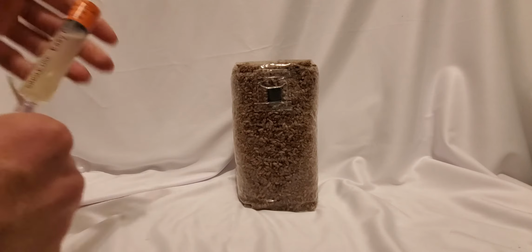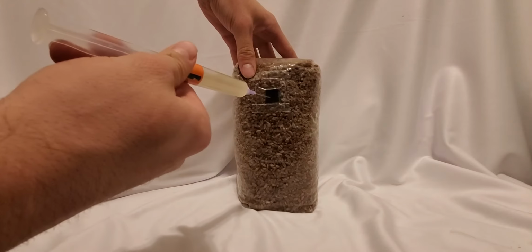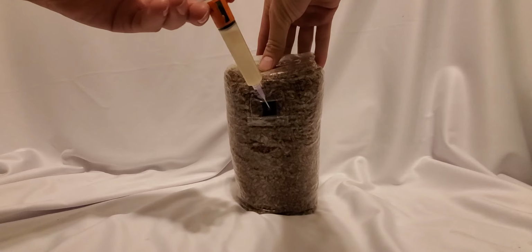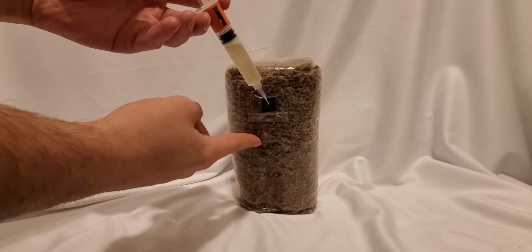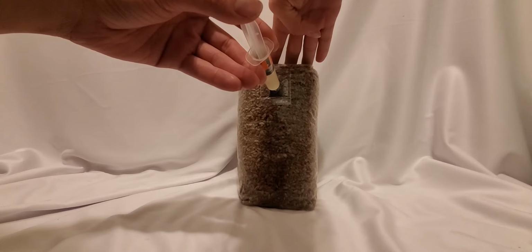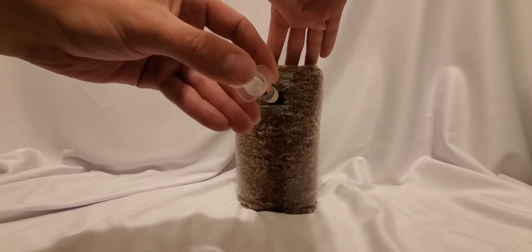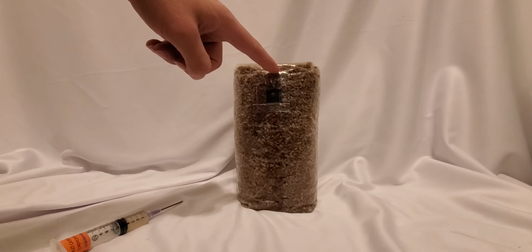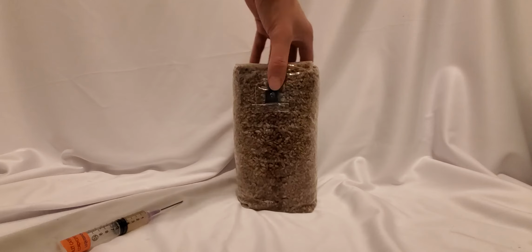Here's a demonstration of it, and you should hopefully be able to see the liquid do what I'm describing. I've leaned the bag forward so you can see it, but if you were to really be doing it, you could adjust the angle of the bag and the depth of the syringe to create a column all the way through the entire bag, and it only needs to expand out this much on both sides, as well as this depth.